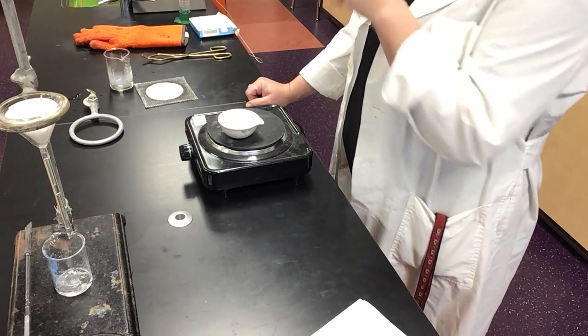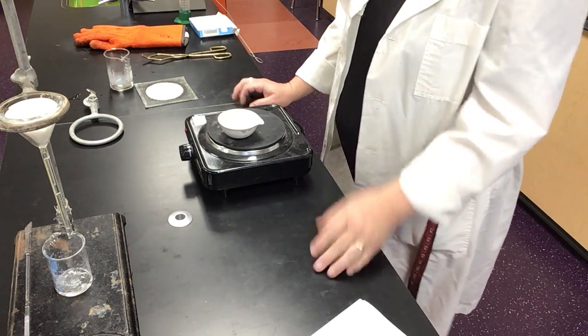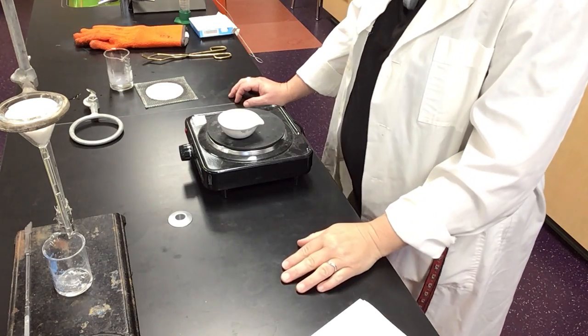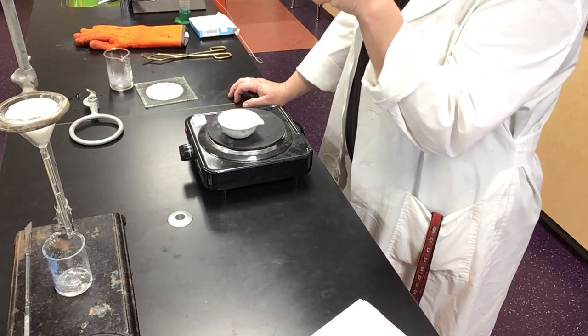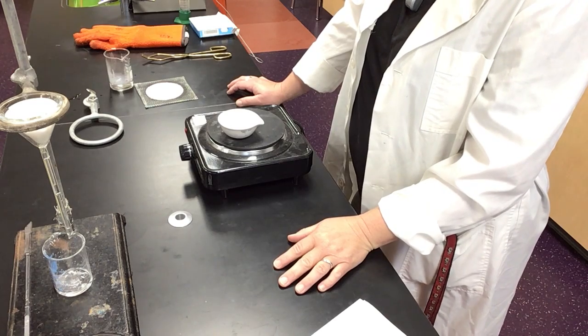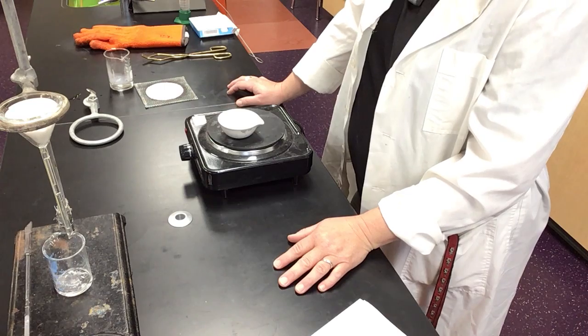This is the point at which, if you were doing this, I would come over and go, oh my gosh, turn that down. What are you doing? But, yes it is on this one. What's going to happen is you're going to start to see spatter in a second. The first thing you'll start to see is the formation of little salt crystals on the sides of the vessel.